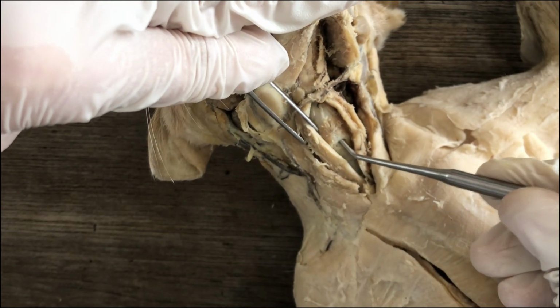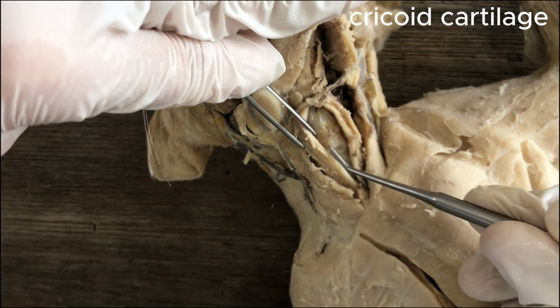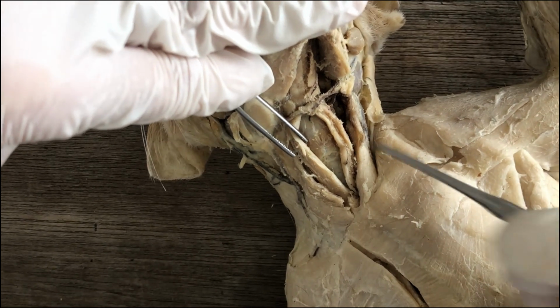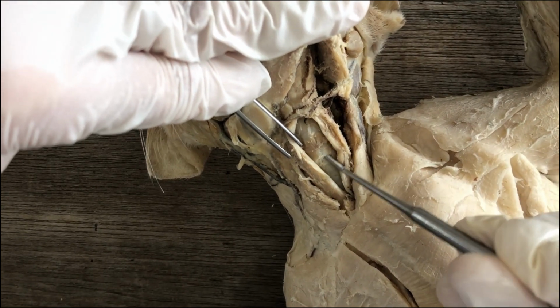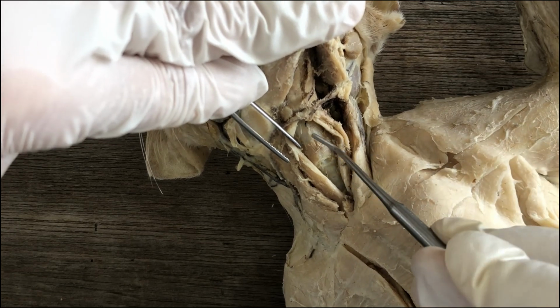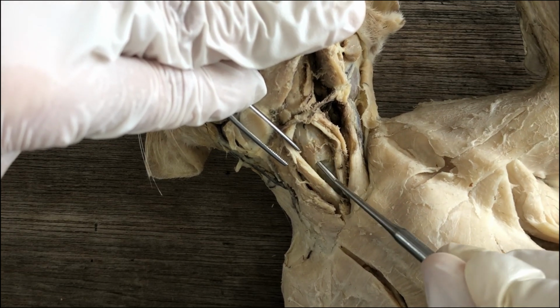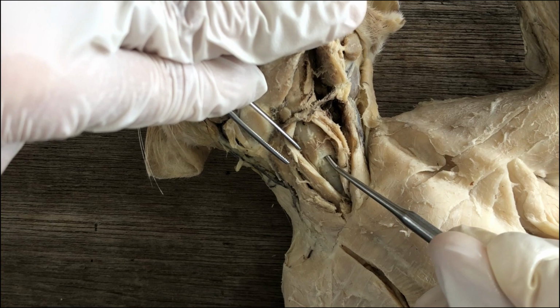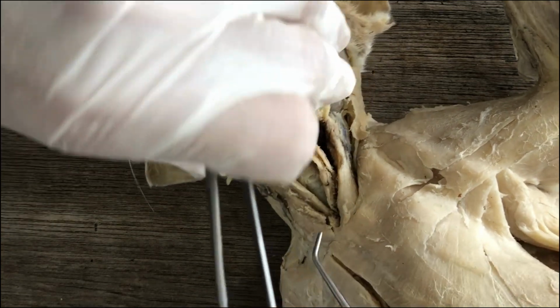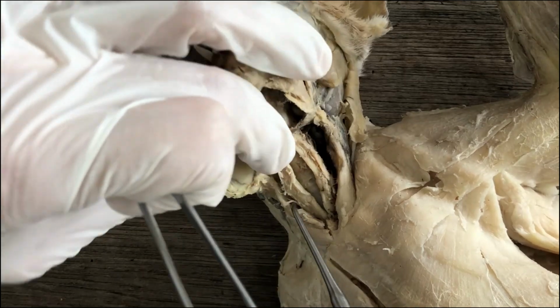This is the cricoid cartilage. It looks narrow and ring-shaped ventrally, but it's actually broad on the dorsal side of the larynx. So thyroid cartilage, posterior to it is cricoid cartilage, ring-shaped. But cricoid cartilage is actually broad.